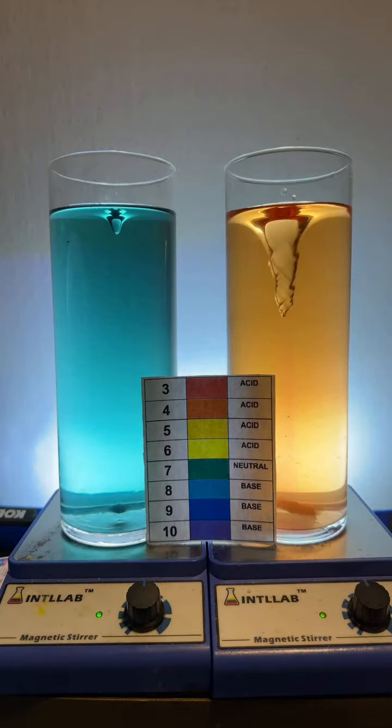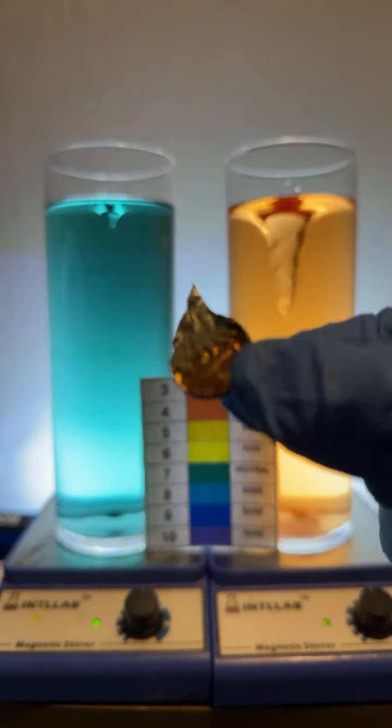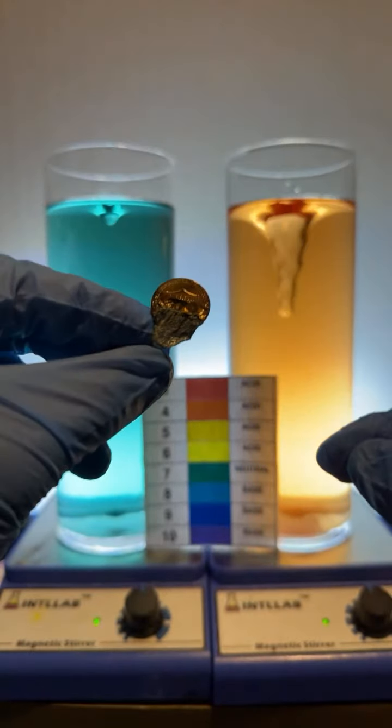All right, somebody has been very patient. They wanted me to react a metal with some acid, so I'm going to do that. I've not done this on the live before, but we're going to give it a shot. This is a United States penny that I've melted. And you say, wait a minute, that's illegal. No, it's only illegal if I try to sell this, okay?